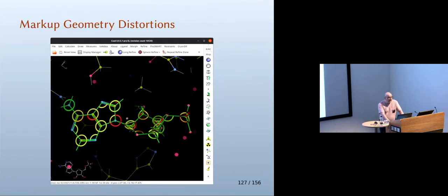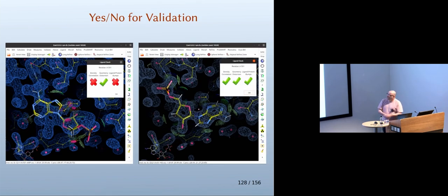We can use markup for ligands, so there's a recent change to the way that the markup works. It now uses a dictionary, which is very typically an ACEDRG dictionary, and you can compare and contrast how your particular model compares to the specified geometry in the dictionary. And there are 3 methods by which your ligand is assessed. This is the quick ligand validation: density correlation, geometry distortion, and ligand interactions with the protein.